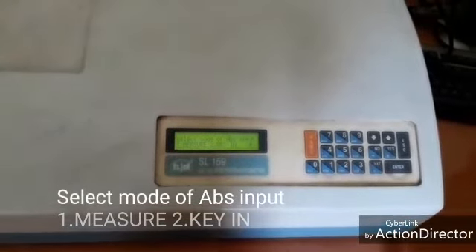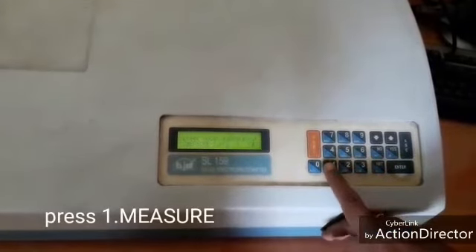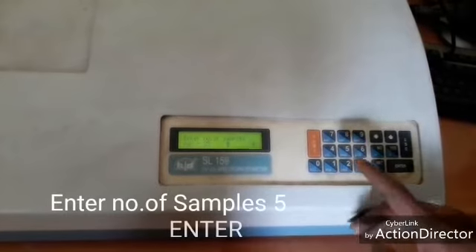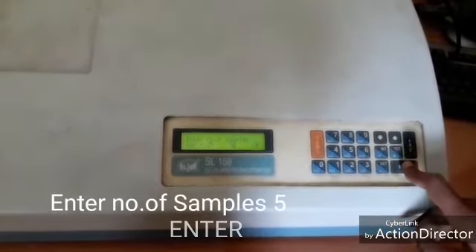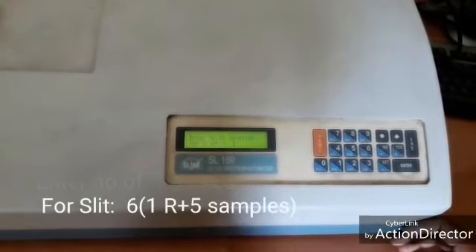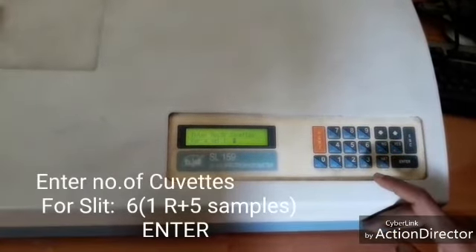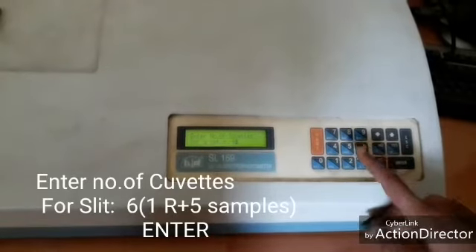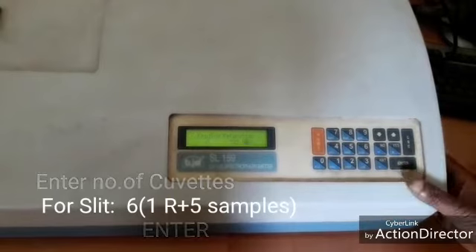Select mode of absorbance input. Press 1. 1 is measure. Number of samples 5. Then enter. Number of cuvettes 6. 1 is reference plus another 5 samples. Total 6. Then enter.